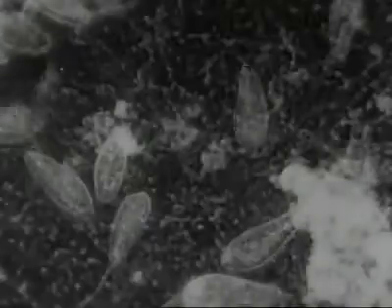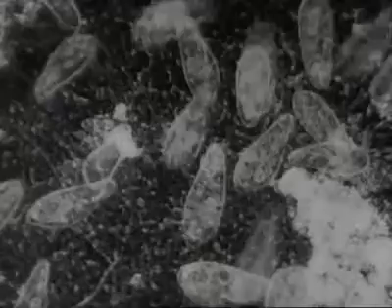The microscope is your window into the world we seldom see, a world of strange creatures. A world where a single drop of water may be teeming with scores of one-celled animals. And yet, this strange world is yours to explore, yours to investigate by means of your microscope.